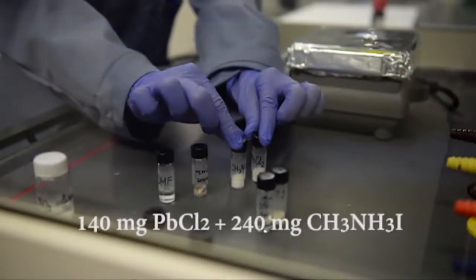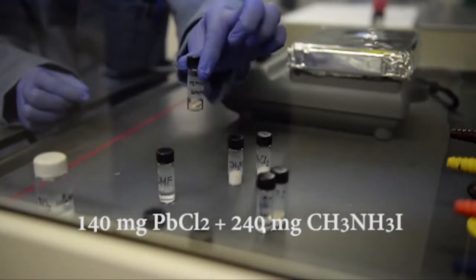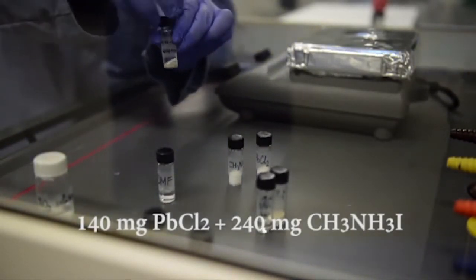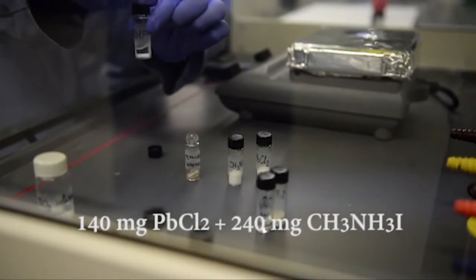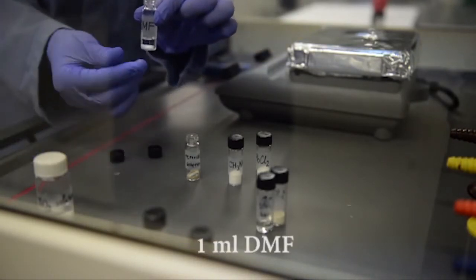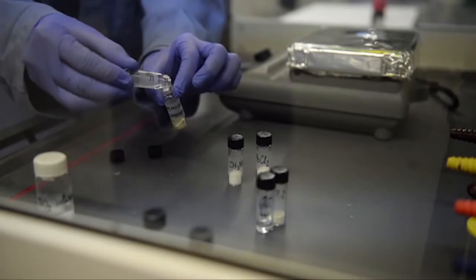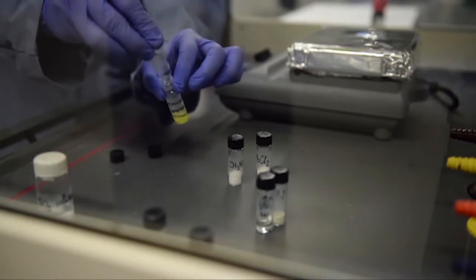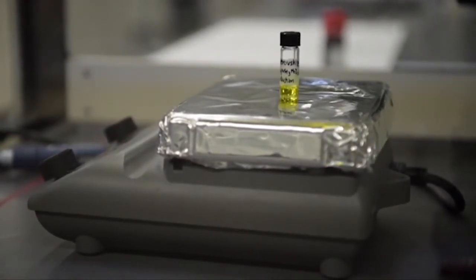The second solution we have to prepare is the light-absorbing material perovskite. To make a 0.5 molar perovskite solution, we will need to mix 140 mg of lead chloride and 240 mg of methyl ammonium iodide in 1 ml of dimethylformamide solvent. The resulting reaction needs to be stirred at 80 Celsius until a homogeneous yellow and transparent solution is formed.